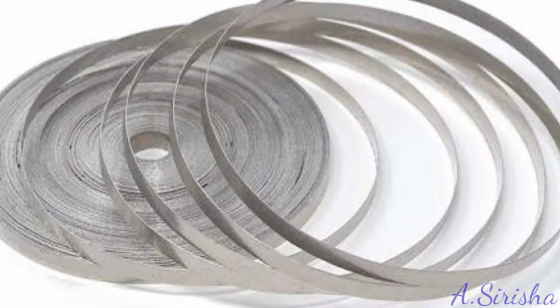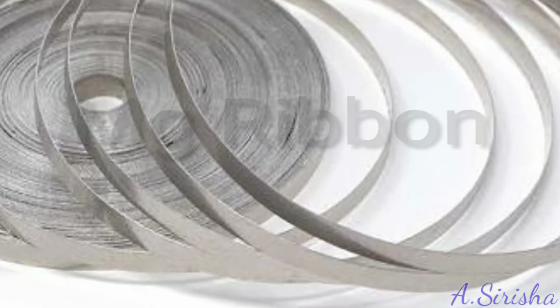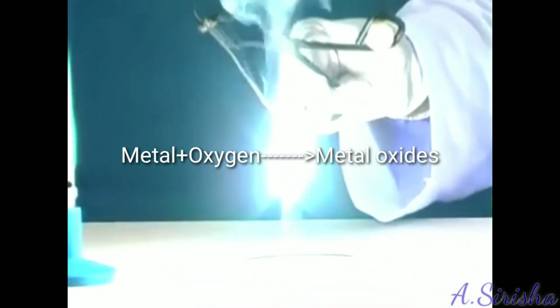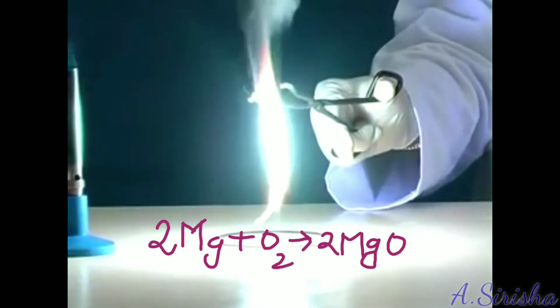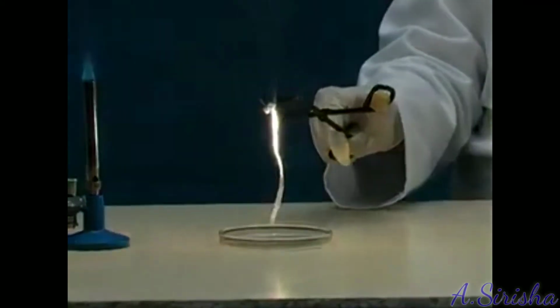Now, let's see the reaction of magnesium with oxygen. Burning of magnesium ribbon is a chemical change. Take a piece of magnesium ribbon, hold it with tongs, and heat it. It starts burning with dazzling light and produces dense white fumes. The white fumes after cooling form a white powder called magnesium oxide.